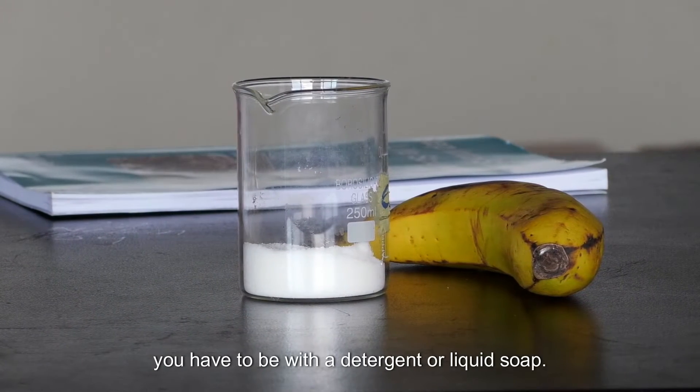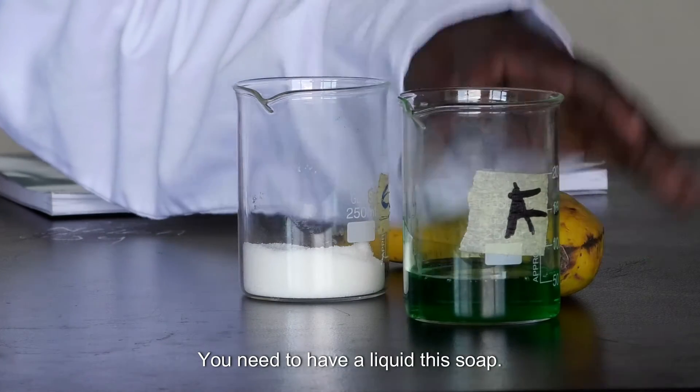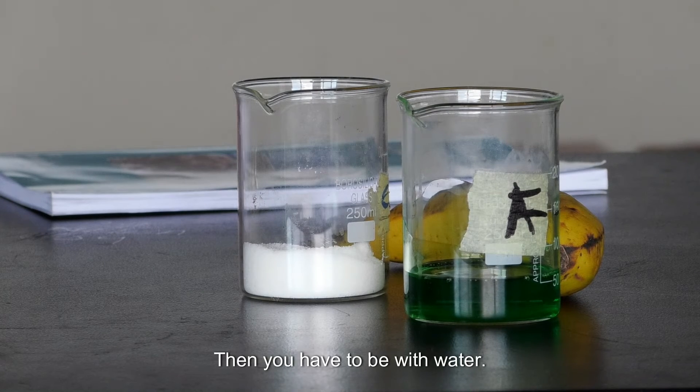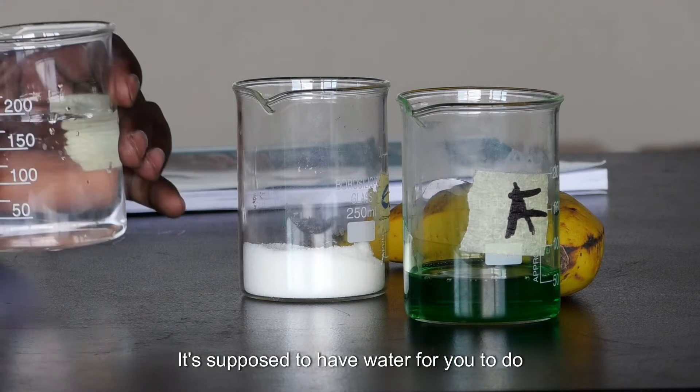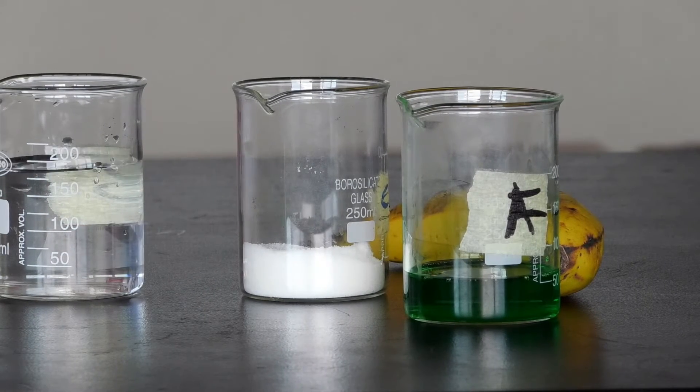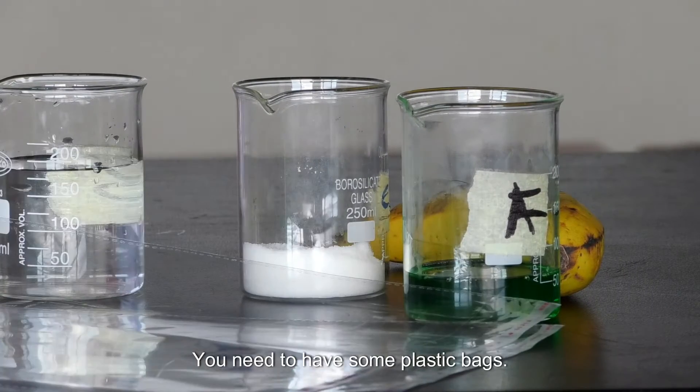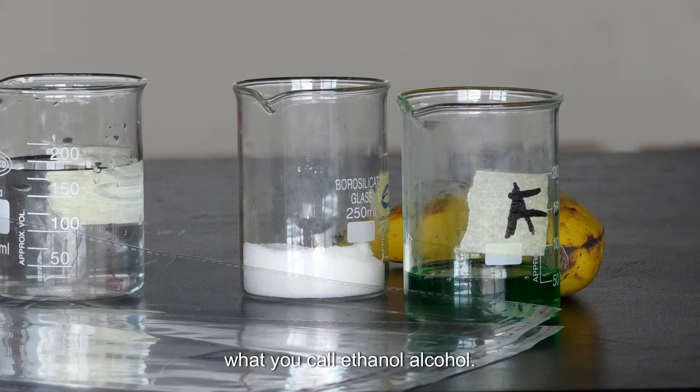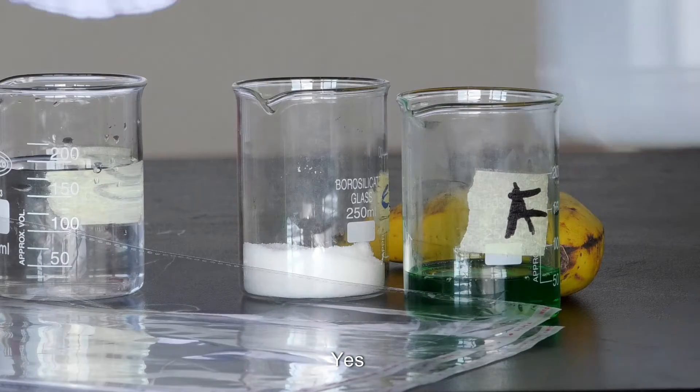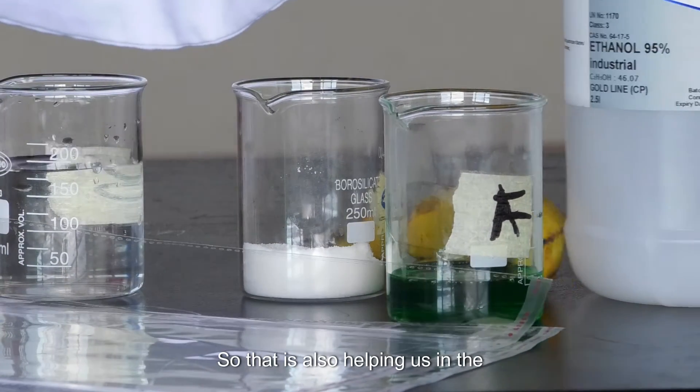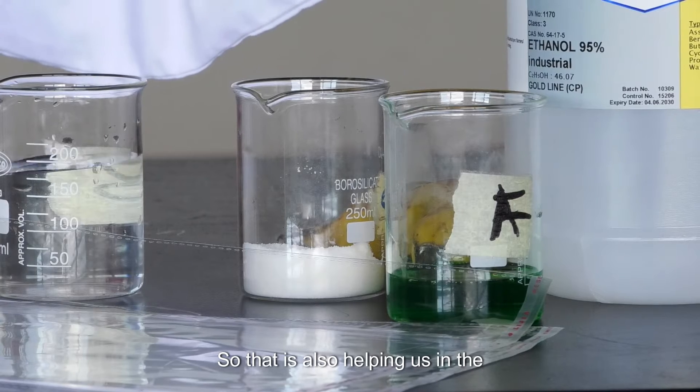Then you have to be with a detergent or liquid soap. You need to have a liquid soap. Then you have to be with water. Then you need to have some plastic bags. Then you need to have what you call ethanol, alcohol, so you need to have it so that it's also helping us in the extraction.